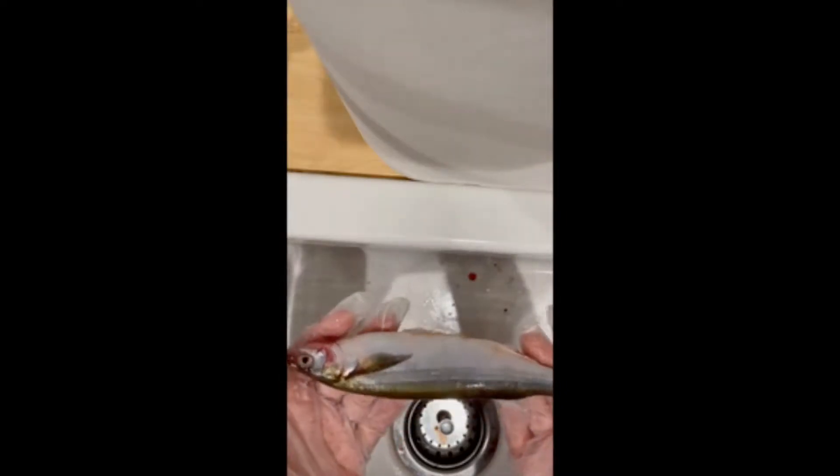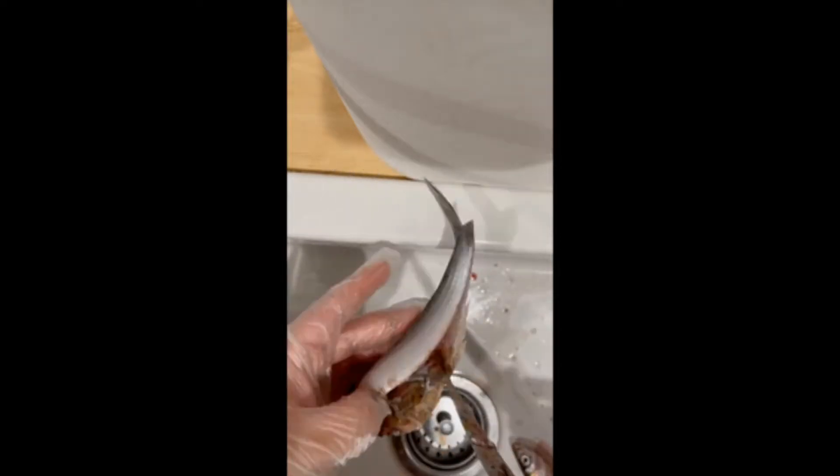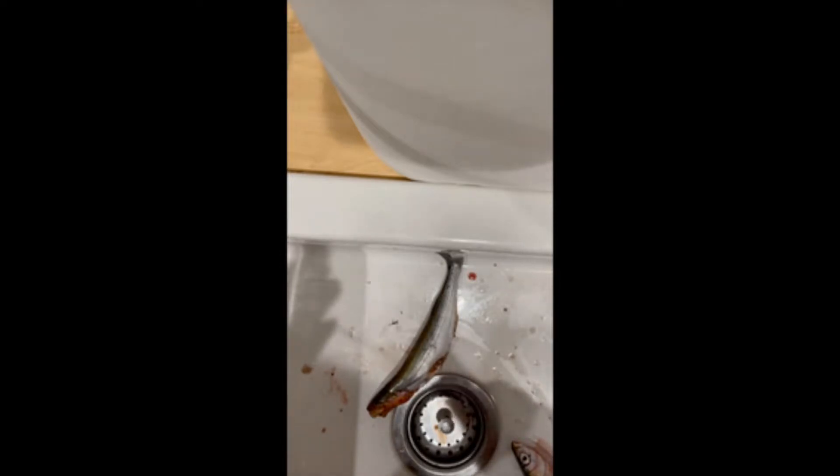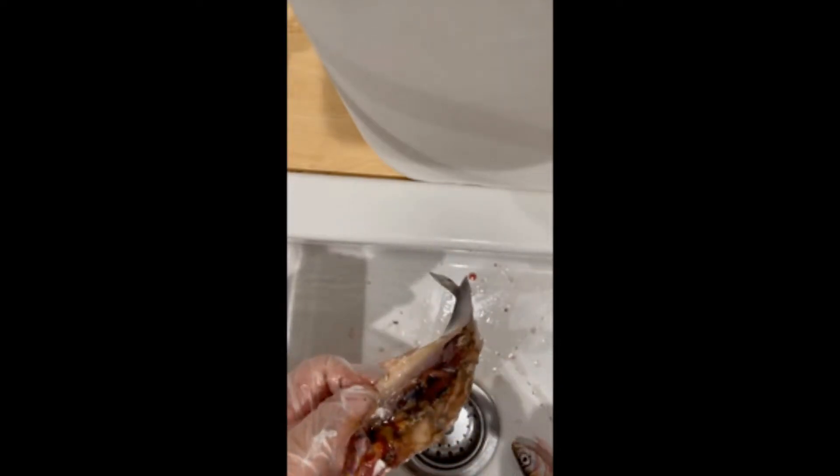This is the second fish from Ventura. It's also a mackerel. It looks a little bit smaller in size, and it has an injury to the end of its fin that was there prior to us catching it. Already its insides look a lot different than the first fish. The stomach was also a lot harder to find — I could spot the other stomach almost immediately, and in this one I had to search around for it a bit. It's like a deflated little sack, which immediately isn't a good sign because you can tell it hasn't been eating anything. I tried to spread it a bit thinner to see if maybe there was something inside, but there was not. So this fish maybe had just digested its food, or maybe it just doesn't have a lot to eat in general, and I think the injury may play a factor in that.